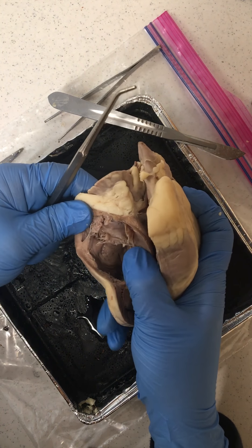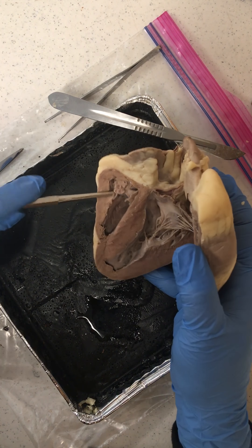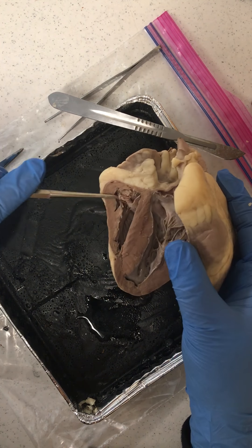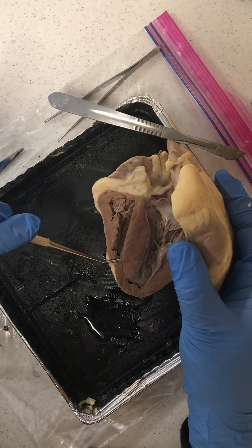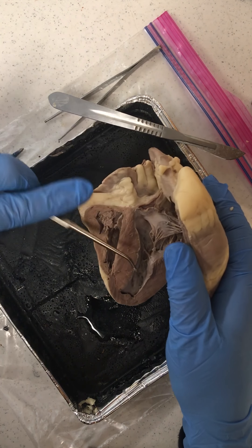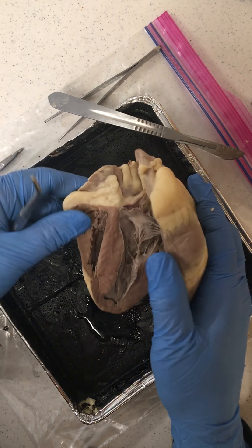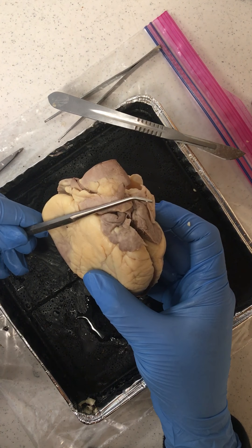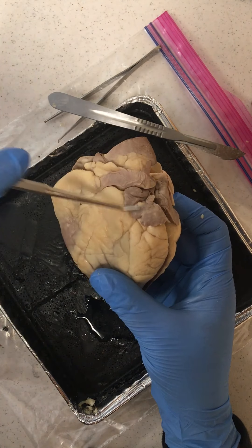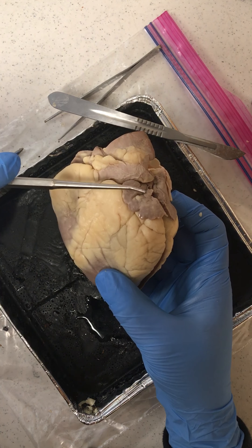When we look a little bit more closely, blood flows into the right atria and is protected from backflow by the tricuspid valve — a one-way valve. That blood then flows into the right ventricle and gets pushed out through the pulmonary trunk. The pulmonic semilunar valve prevents backflow of blood into the right ventricle. That pulmonary trunk carries deoxygenated blood out through the left and right pulmonary arteries to the lungs, where it becomes oxygenated and then comes back through the pulmonary veins to the left atria.